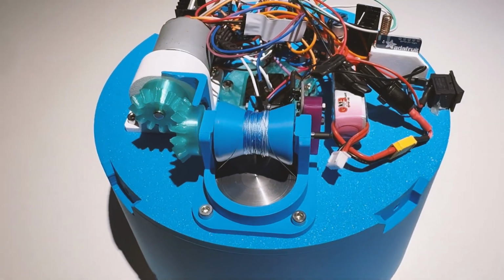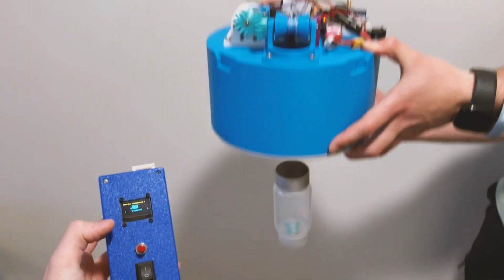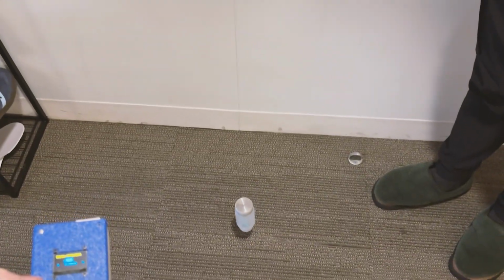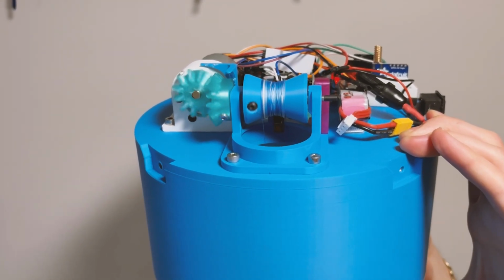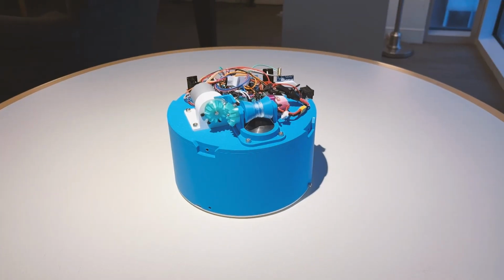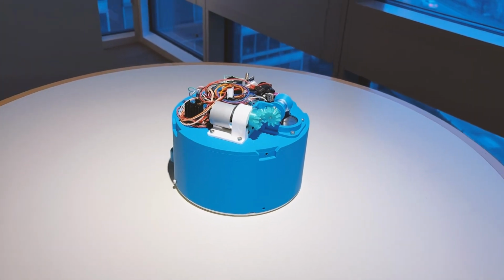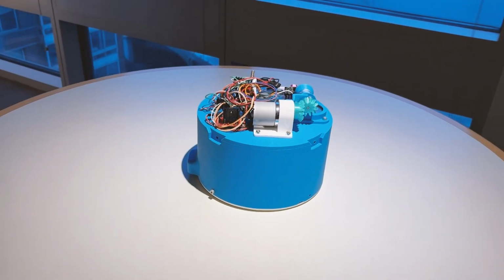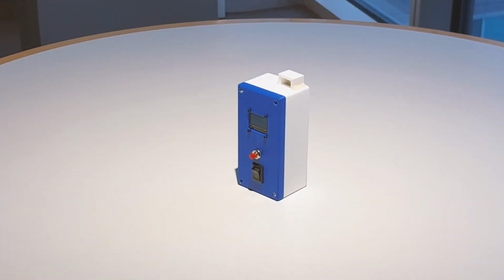The distance to the ground is measured by a LiDAR distance sensor, which is used in combination with a Hall effect sensor to determine how long the motor should spool to lower the sample just below the water's surface, and how motor speed modulation is applied to slow entry and exit of the sample into the device and into the water. Distance is also used to determine if the device is within a sampling height range of around 30 feet. Flight instructions using the height data is relayed through LoRa connectivity to the remote controller.